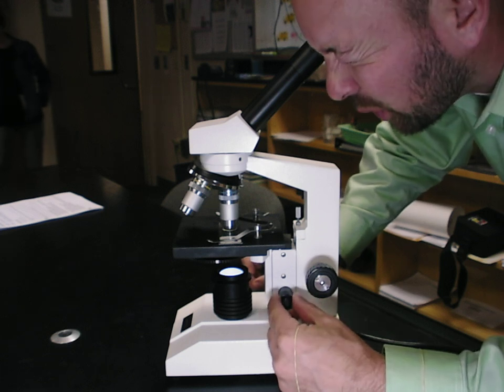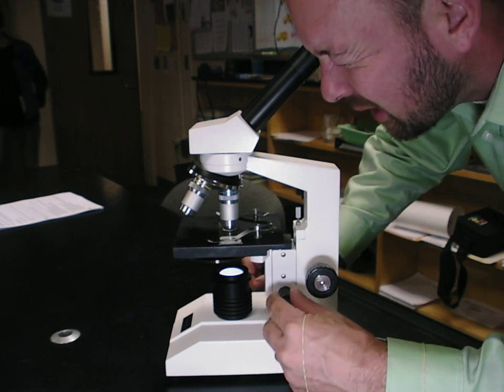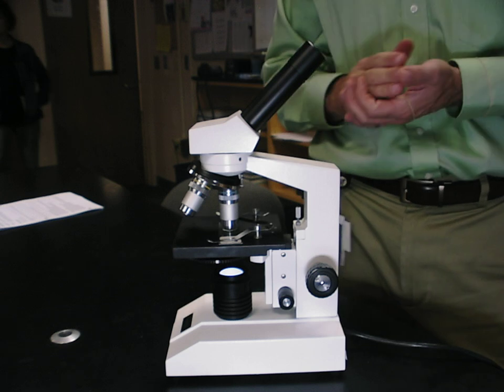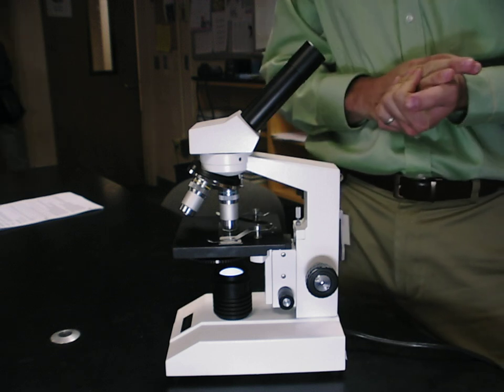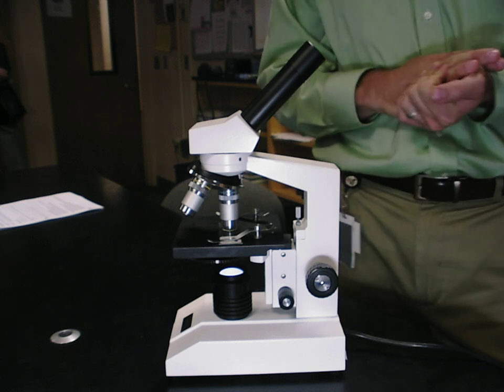Now, focus again, only using the fine adjustment. That's your best bet to see whatever it is you're looking at. If you do that, then 90% of the time you're going to find the cells. If you don't do that, you're going to be lost.